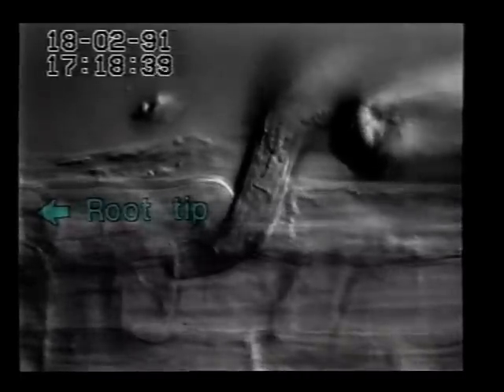The intercellular space is now widened and the nematode has already pushed its head into it. It now enters the intercellular space and starts to migrate towards the root tip. Intercellular penetration obviously did not cause any damage to the rhizodermal cells. Juveniles which penetrated the root intracellularly leave the cells which they have entered and also proceed migration within the intercellular space. During migration, the nematode permanently repeats the pattern of behavior: stylet thrusting, protrusion of the stylet, followed by activity of the median bulb and stylet withdrawal.